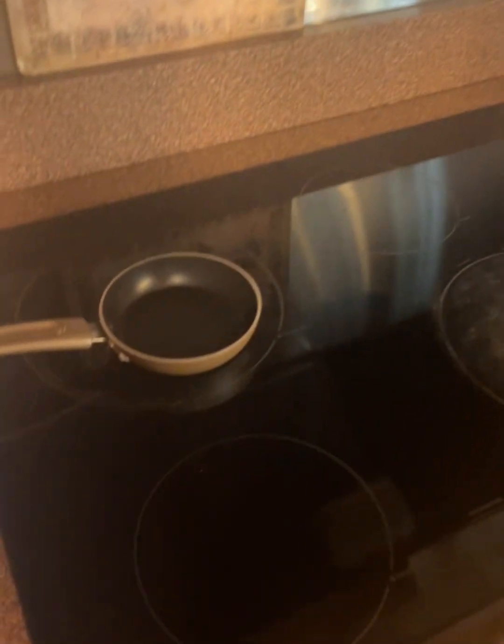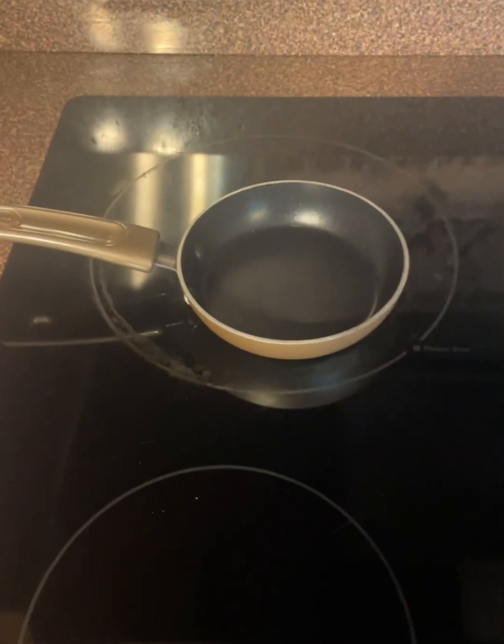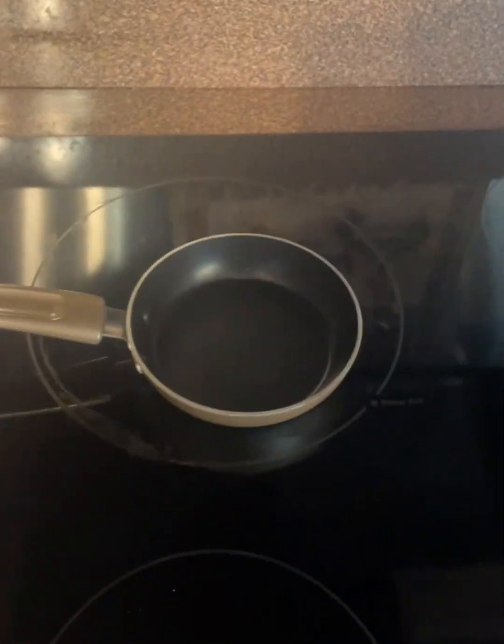I will be using a chemical and physical method to control microbial growth using my leftover 21-day sauerkraut brine. I have all my PPE on: my safety glasses, my hair is up, I have my lab coat on, and I have gloves. I have already disinfected my working surfaces with my 10-to-1 bleach solution. So let's get started.